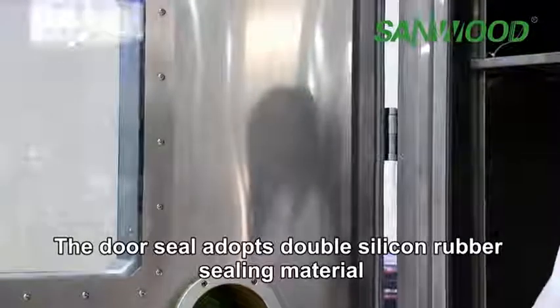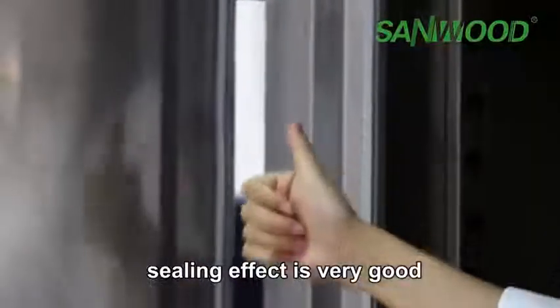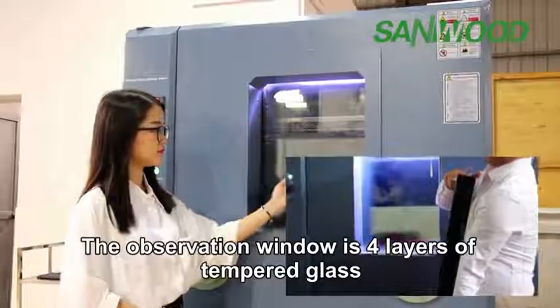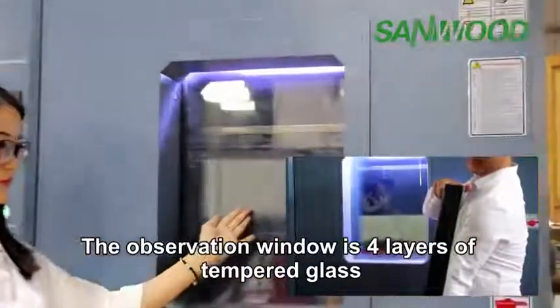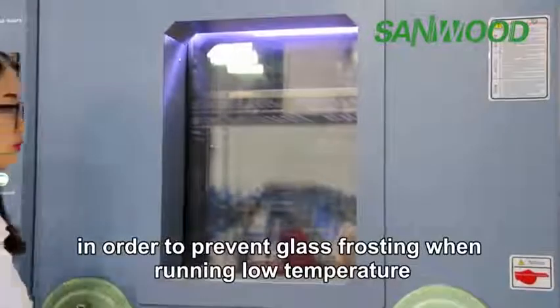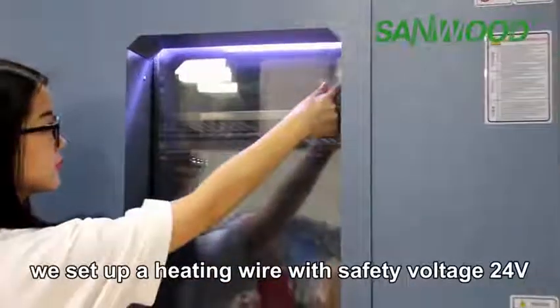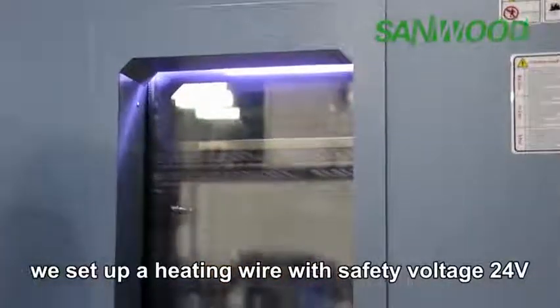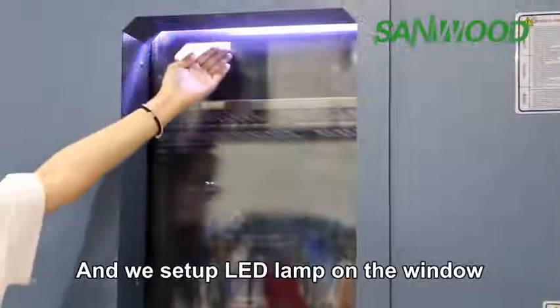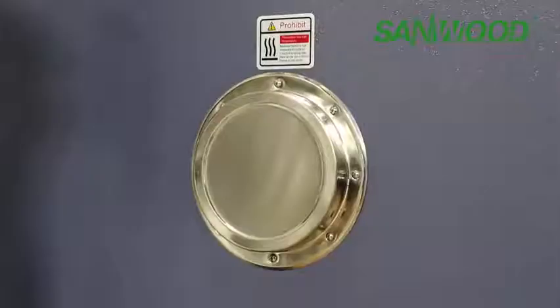The door seal adopts double silicone rubber sealing material. The sealing effect is very good. The observation window is 4 layers of tempered glass, and the size you can choose by yourself. In addition, in order to prevent glass frosting when running at low temperature, we set up a heating wire with safety voltage of 24 V. And we set up an LED lamp on the window to provide lighting for observation.